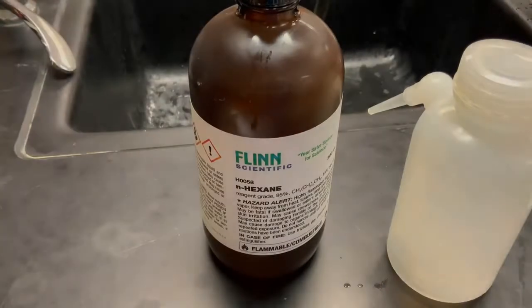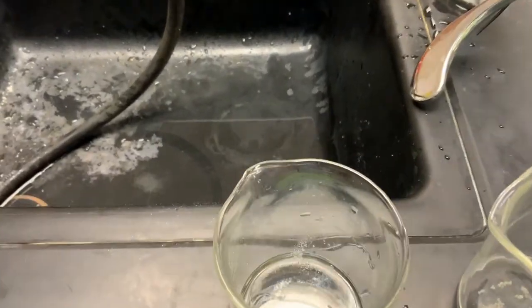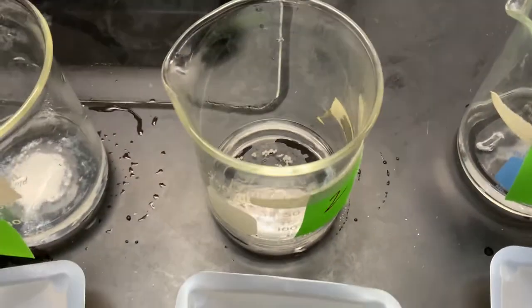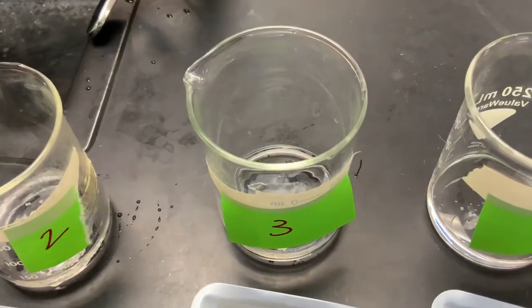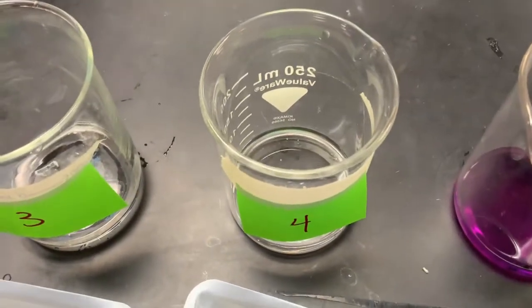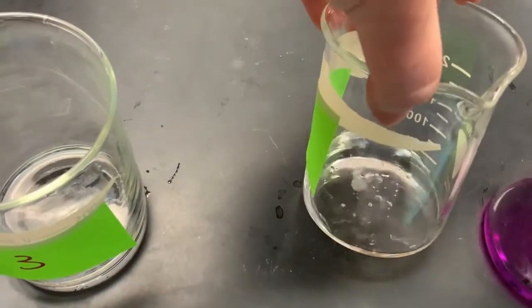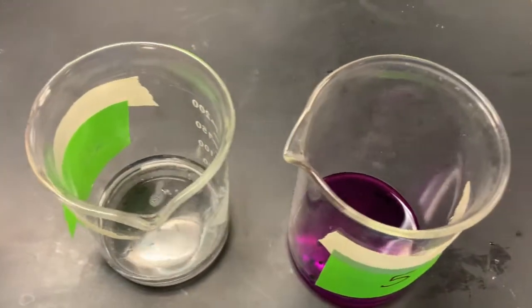For the hexanes test, here are your results. One. This is number two. Three. Four. And five.